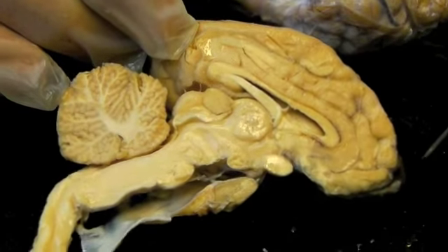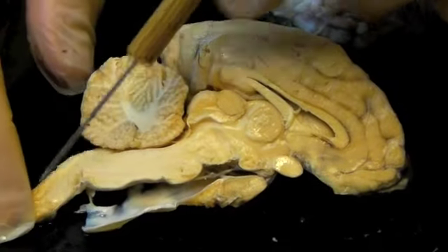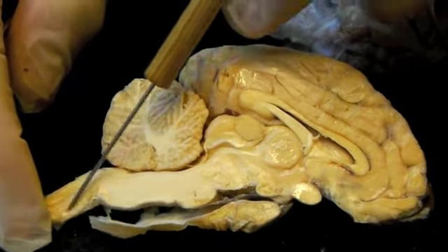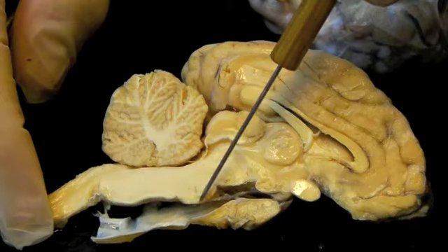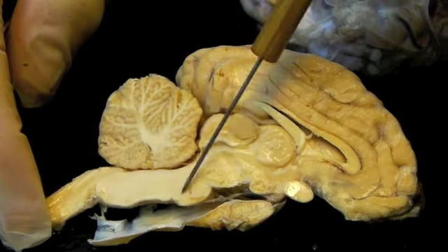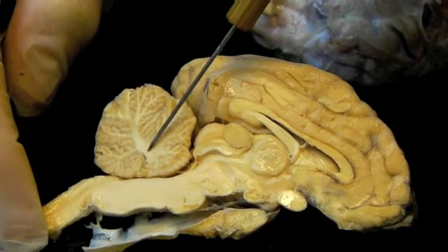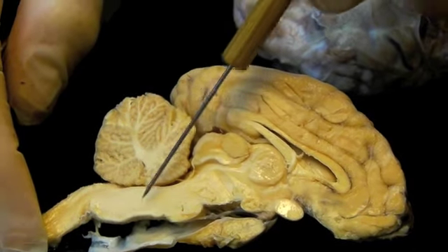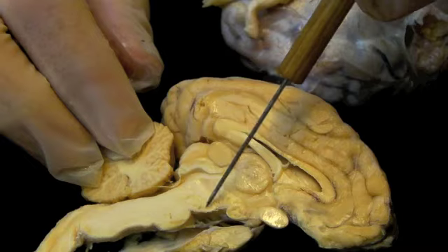So up here is the cerebral hemisphere, anterior, posterior cerebellum. Starting from the medulla, the spinal cord enters the foramen magnum and becomes the medulla of the brain, the first part of the brainstem. Then the pons is an anterior prominence here, and superior to the pons is the cerebellum, and the white matter of the cerebellum is seen here. This is called the arbor vitae. And continuing up, superior to the pons is the midbrain.